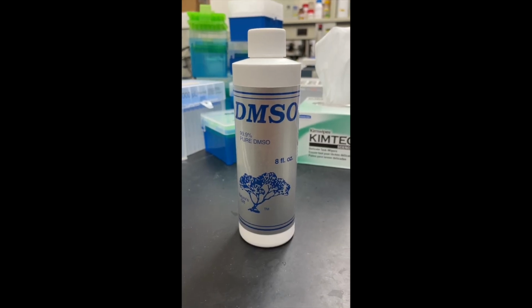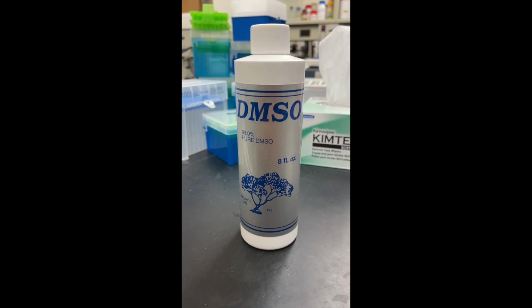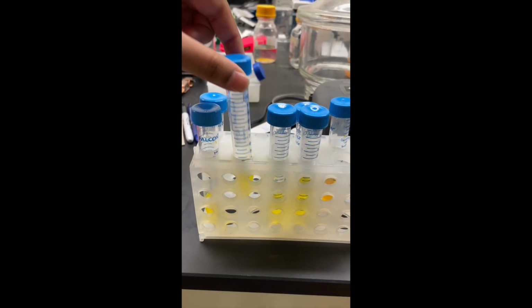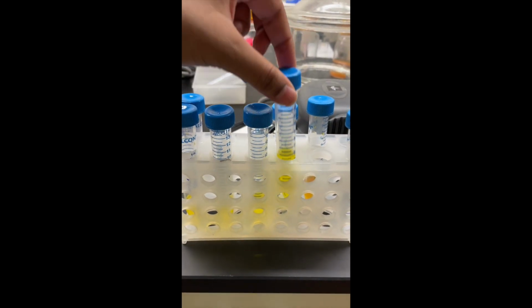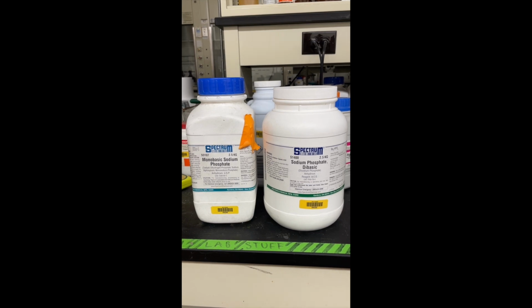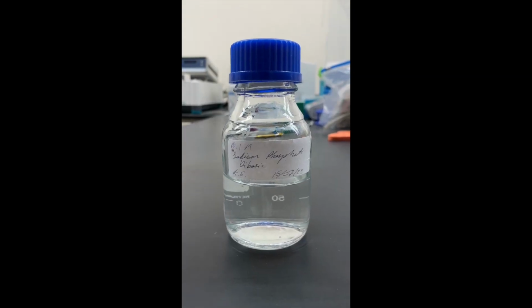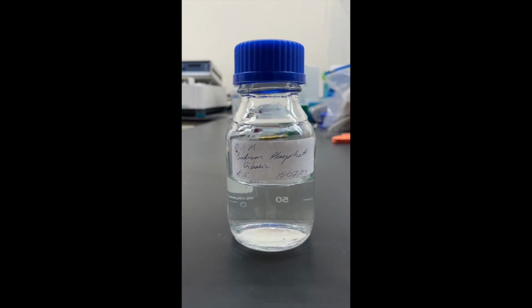We store our compounds in DMSO, an organic liquid that dissolves these molecules. Here's curcumin in 4 vials, each having half the concentration of the last. We also have a buffer at a pH of 7, which is similar to the regular water you get from your tap. This helps us to make sure that the molecules don't react when we're testing them.